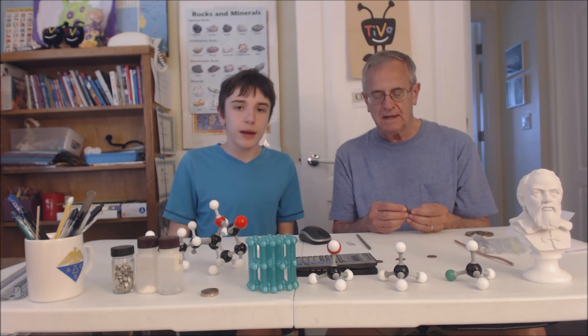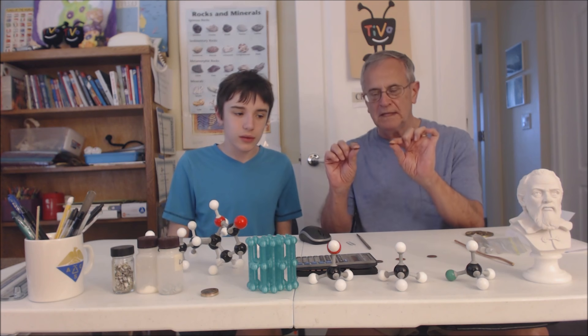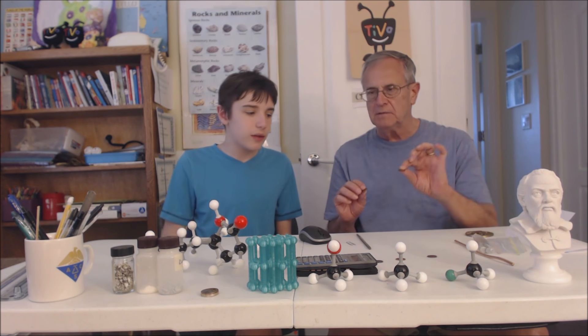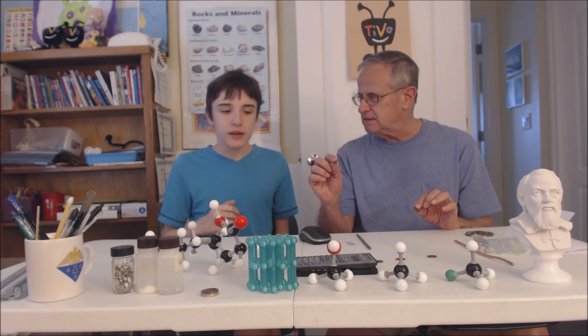I'm Chemical Charlie and I'm Peggy Pepin and we're going to do a little experiment with two pennies. One is an old penny from 1979 and the other one is more modern, from 1998.